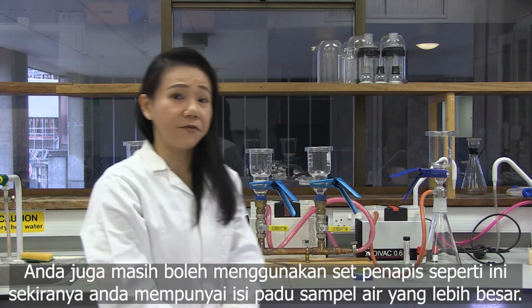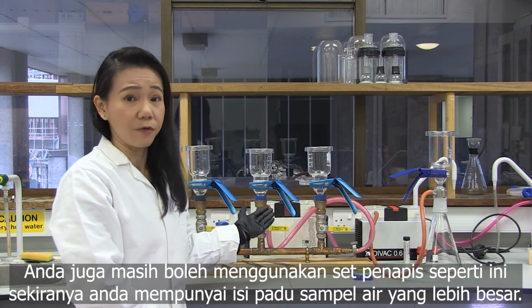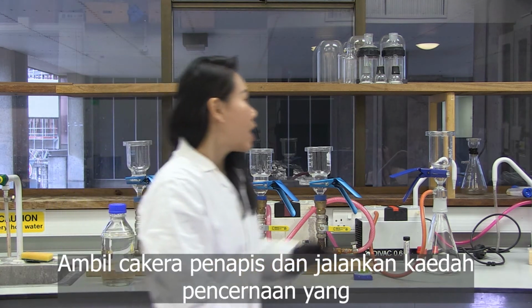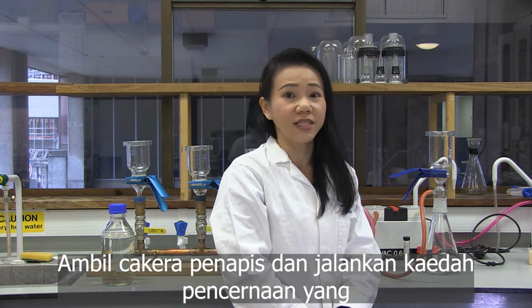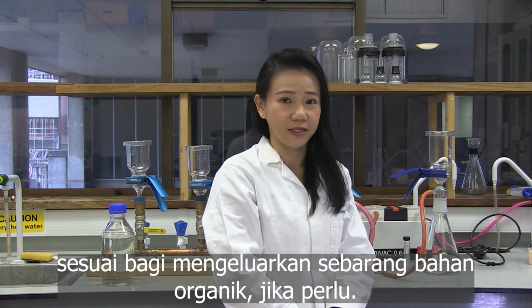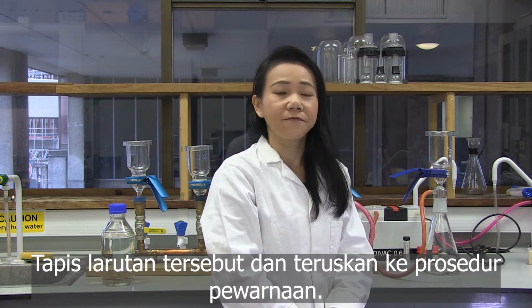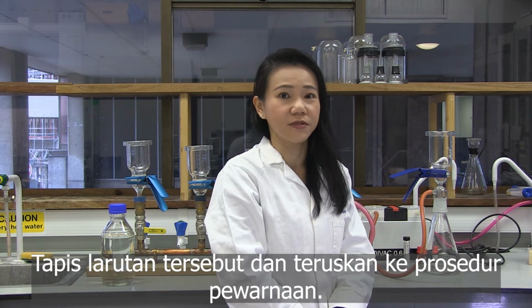Of course, if you have a larger volume of water sample, you can use this sort of filtration set. Retrieve the filter disc and apply a suitable digestion method to remove any organic matter if necessary. Filter the solutions and proceed to staining procedures.